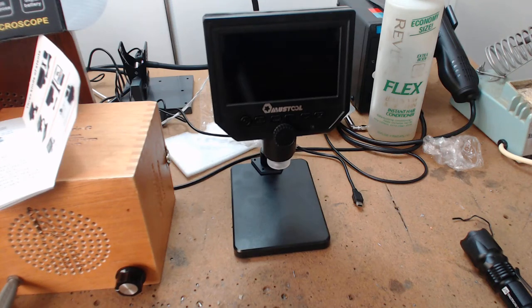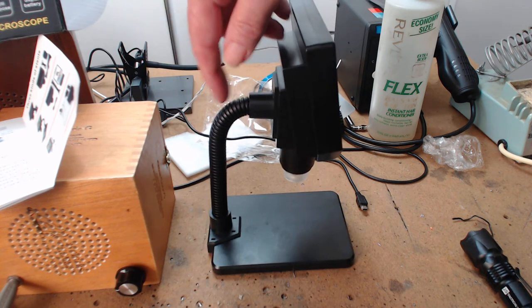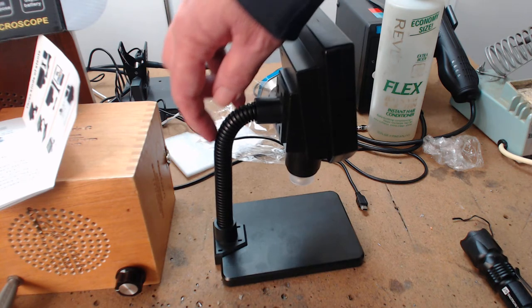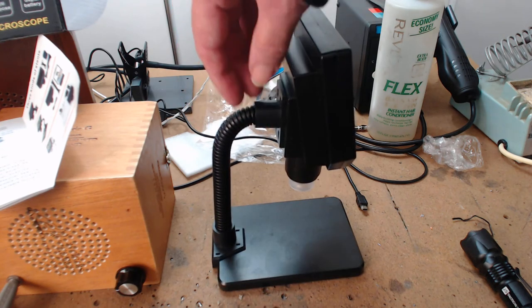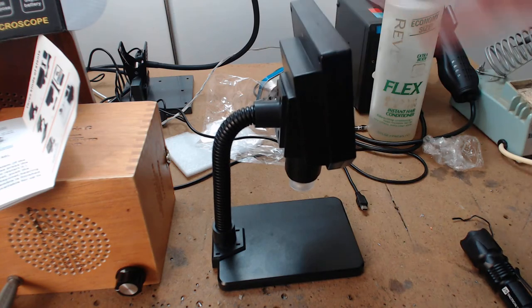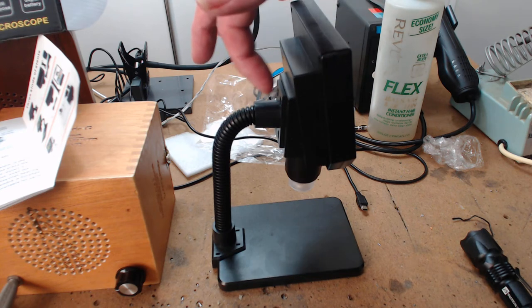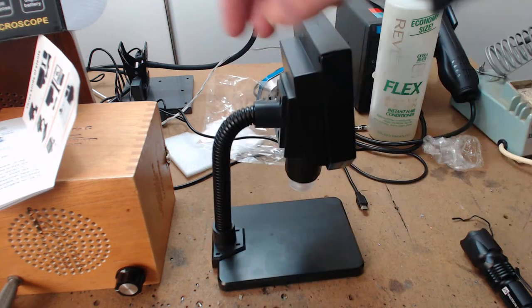All right, this is just a rant about this microscope I bought on eBay, e-dumpster, e-pay, whatever you want to call it. It's got this pseudo, we'll call it gooseneck. It's not really a gooseneck. It's shaped like a gooseneck. It's got, I think, a rod of lead maybe in there, some type of tubing of lead, and you have to bend this. It clicks down at the bottom, but at the top it doesn't. So if you don't do something about that, this could drop off and you could ruin it. So what I did was I put a little bit of silicone caulking in between and put it in a position and let it cure. That's so this won't drop off on me if I pick this up.